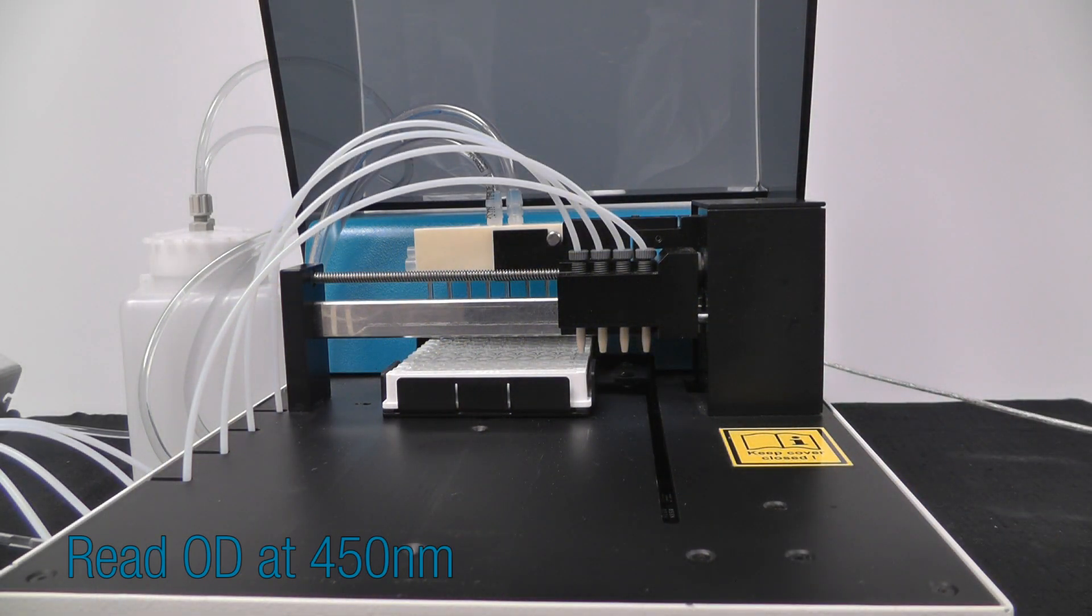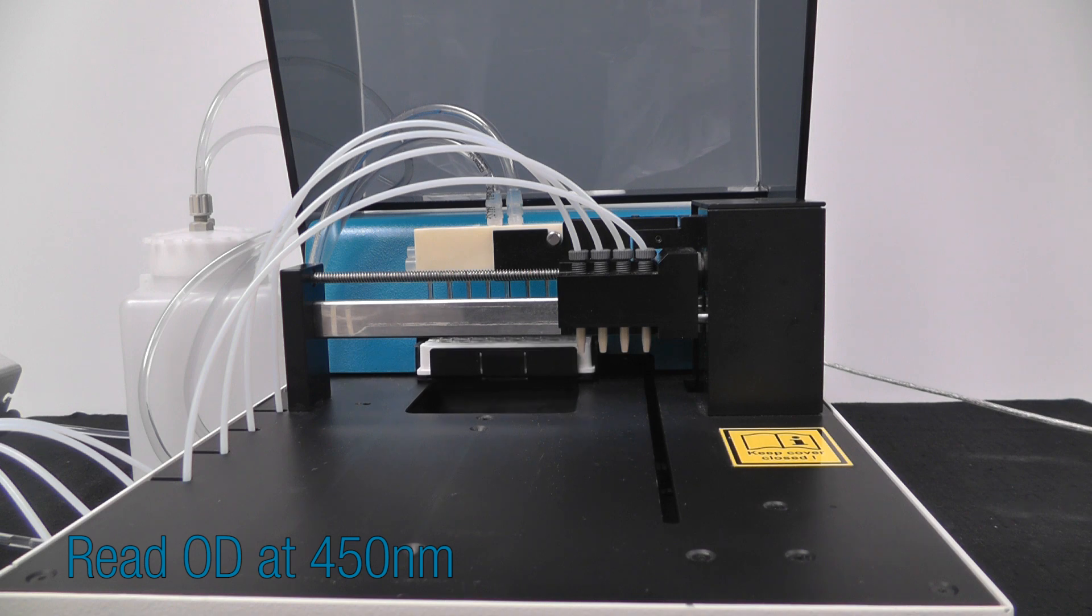Finally, the crocodile reads our microplate at the specified 450 nanometer wavelength.